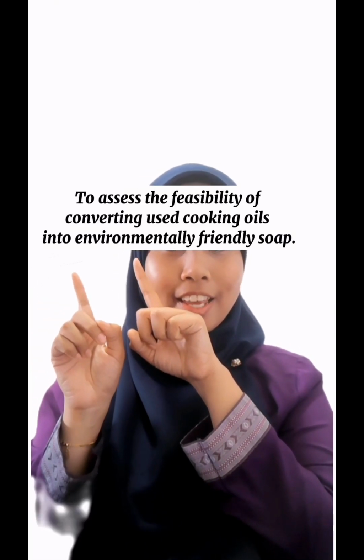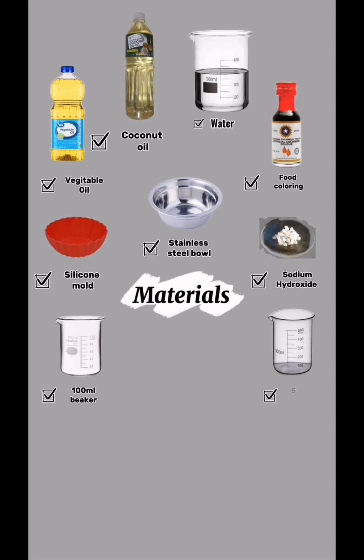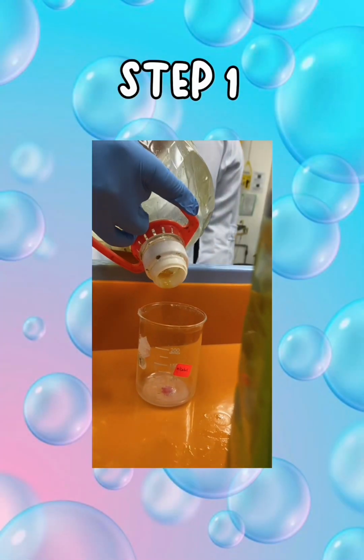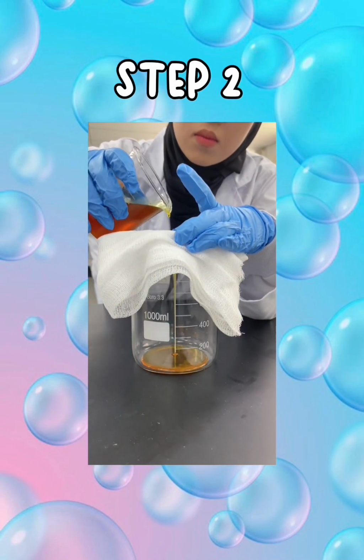The two objectives for these experiments are this one and this one. The apparatus and chemicals used in these experiments are as follows. Firstly, measure 150 ml of used cooking oil and coconut oil, and filter the oil to remove any food particles using a filter cloth.